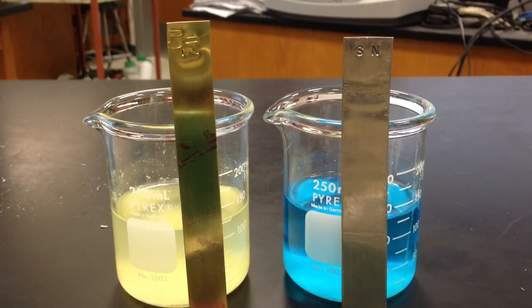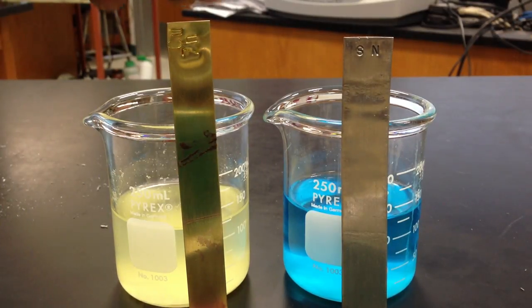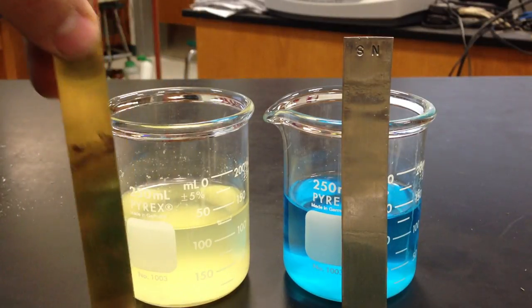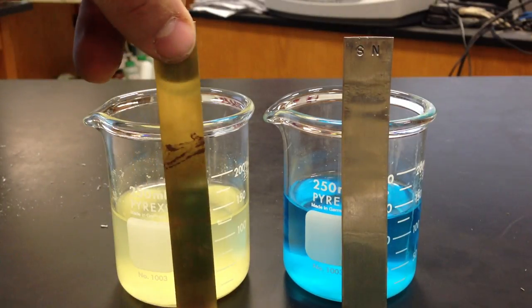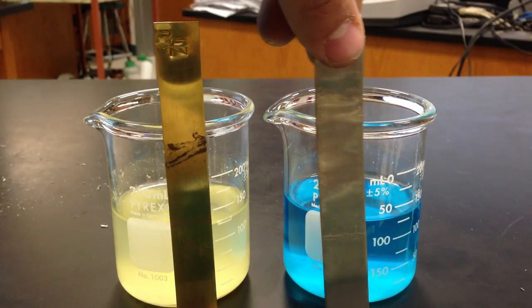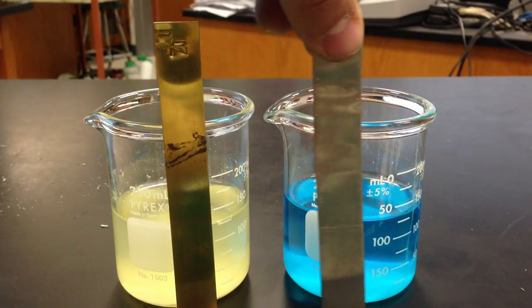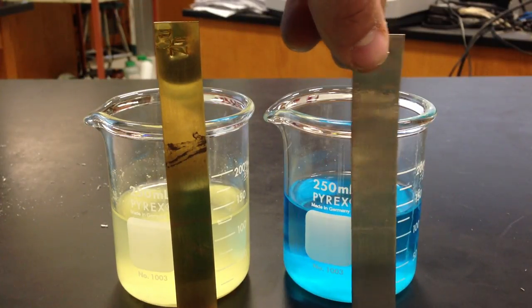What I have here is my copper metal in front of a tin chloride solution, and my tin metal in front of a copper solution. Notice the color of the copper solution.